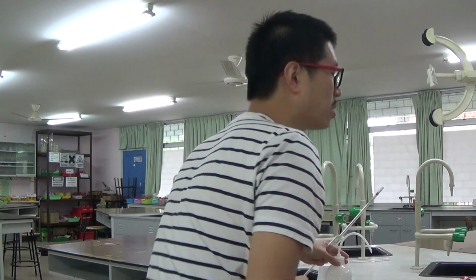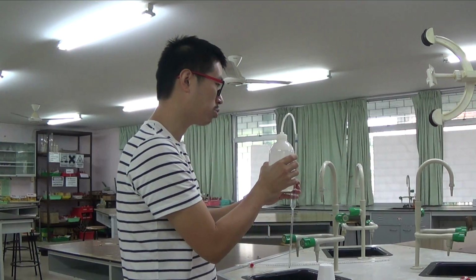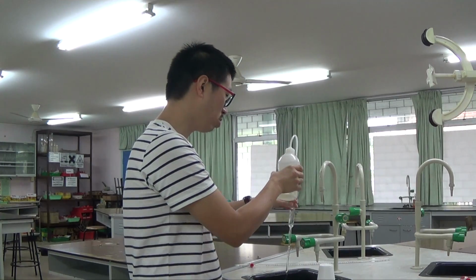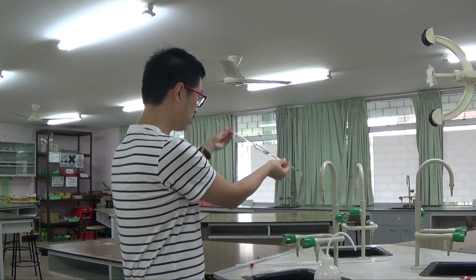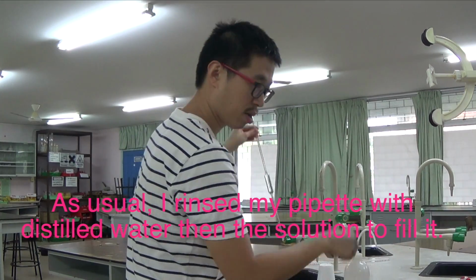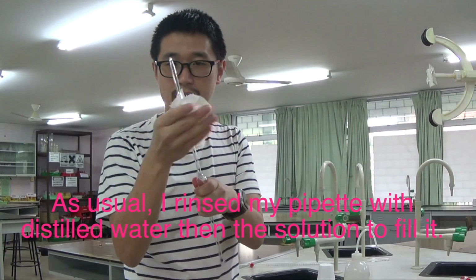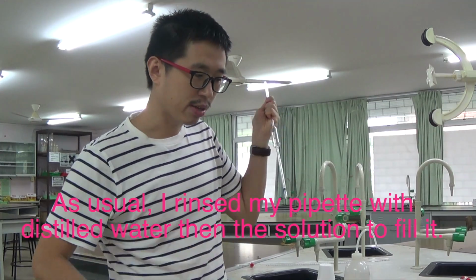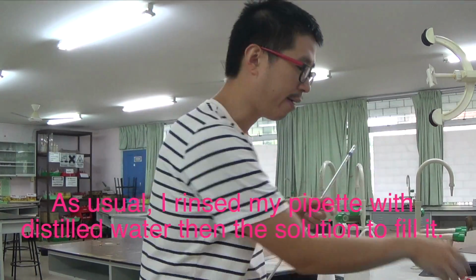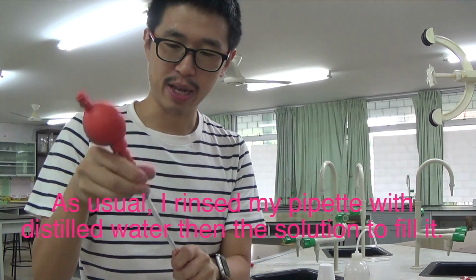So before we use the pipette, we always have to rinse it with distilled water, but the one you're provided in the exam usually is pretty clean already. I'm just gonna take that extra precaution and rinse it with some distilled water. So I've got some distilled water on the outside. I have to wipe it dry first before I pipette out a little bit of P, because I will have to rinse the pipette with the solution that you're going to fill it in.